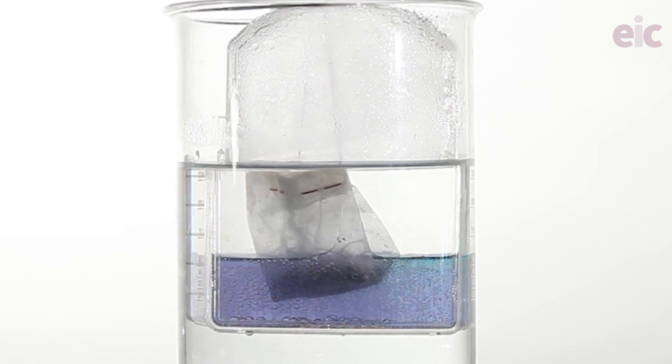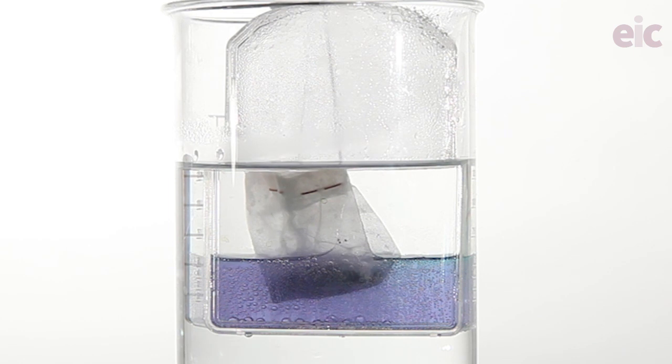And there you have it. Vanadium 2 in well under 10 minutes.